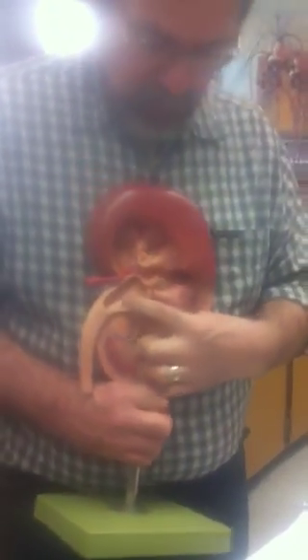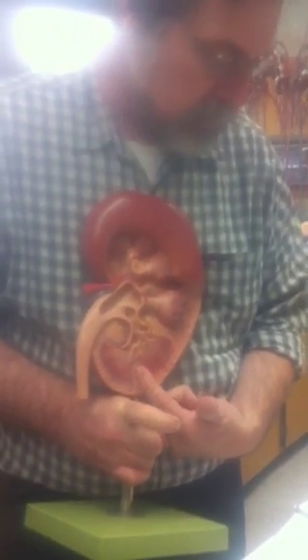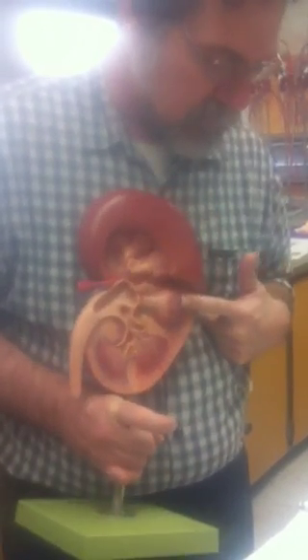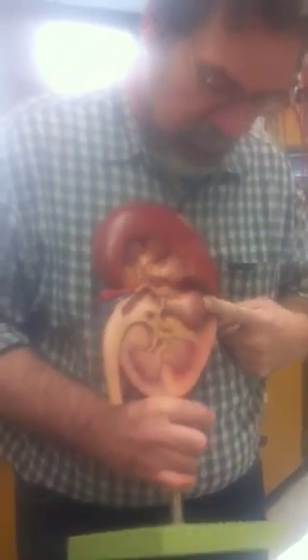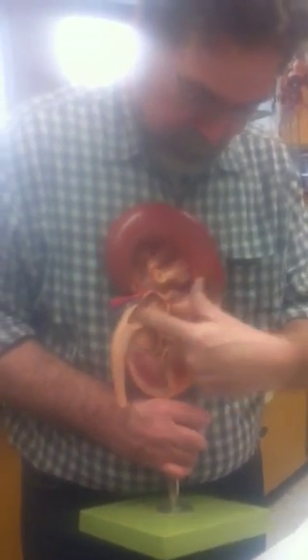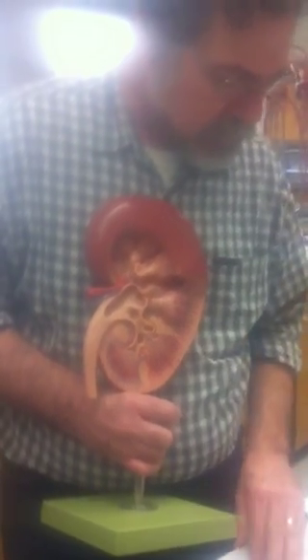Part 2, so renal capsule covering the pelvis. This is the pelvis. Cortex. The cortex actually tucks down in between the pyramids, and that's where the columns are. So the cortex is continuous with the columns. Does it look like a pyramid? No, it's like a funnel. Why do they call it a pyramid, I wonder? Because when you slice it, it looks like a pyramid. Papillae, minor calyx, major calyx, pelvis.